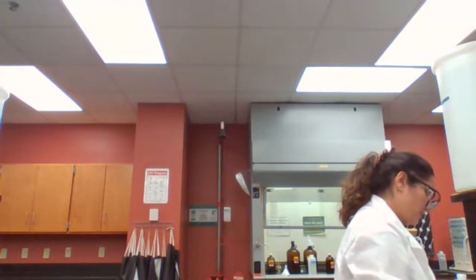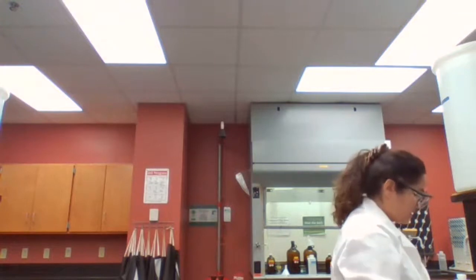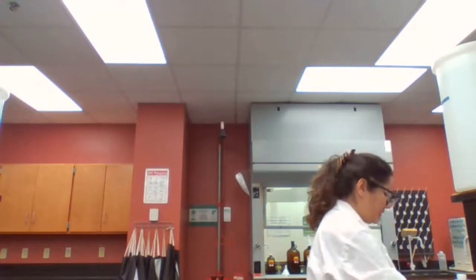And from your data sheet, yes, that's what you need after the filtration. And you finish your observation. There are a lot of questions about observation, so I hope that you did pay attention from the beginning of this video in order to record your observation and be able to fill out and answer questions in the data sheet. Thank you. I'm going to stop the recording. That's end of experiment 9.